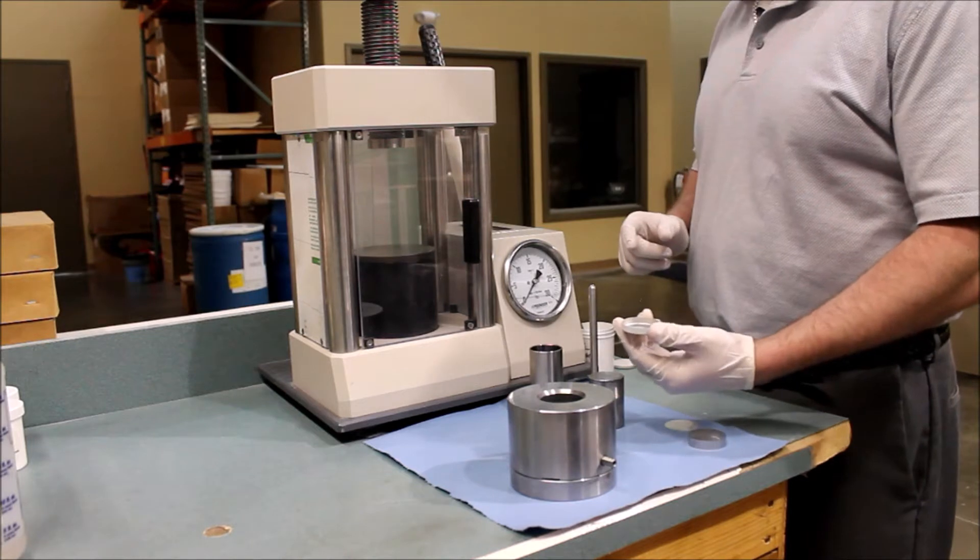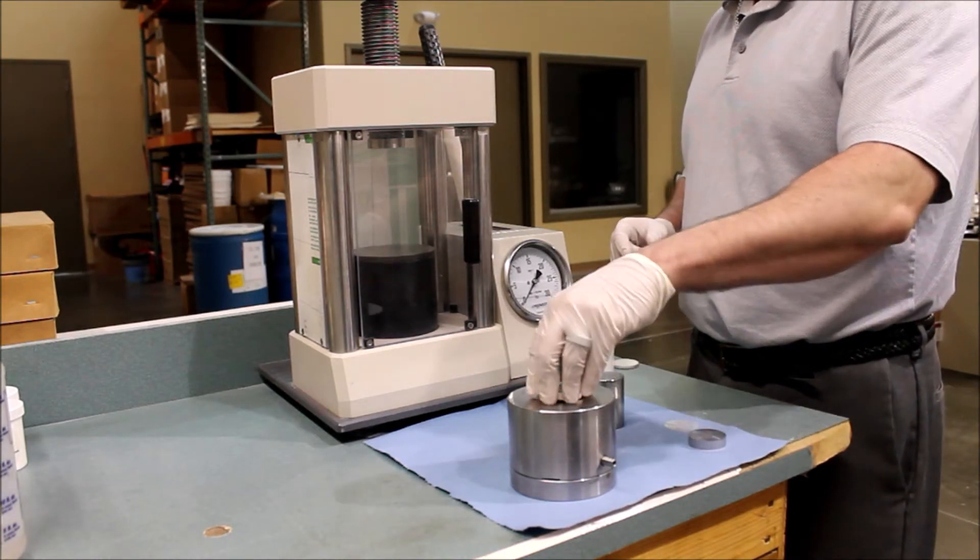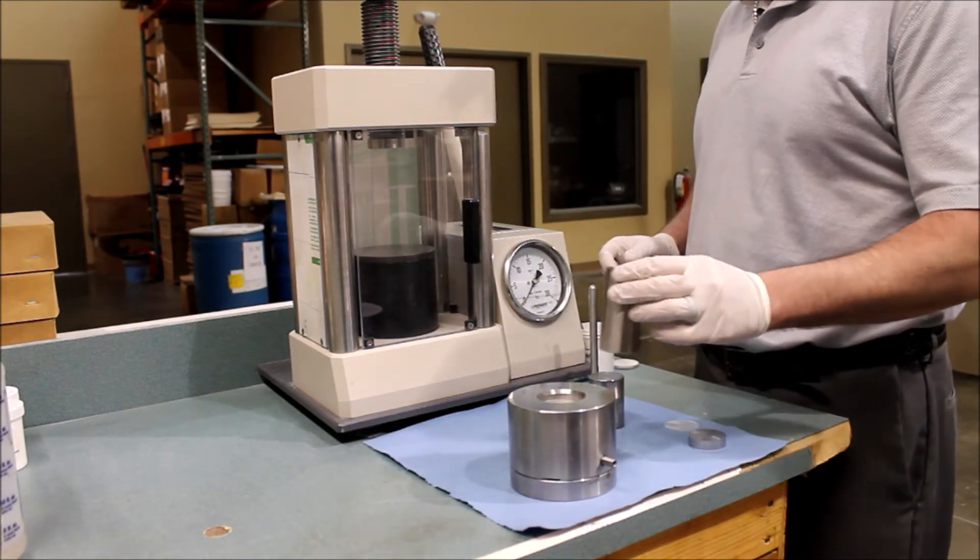From there, insert the aluminum cup and place the filling cylinder inside the bore.